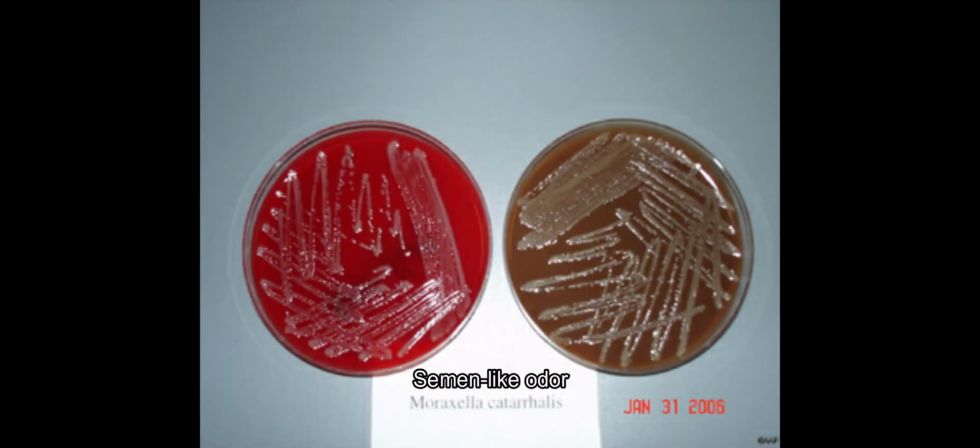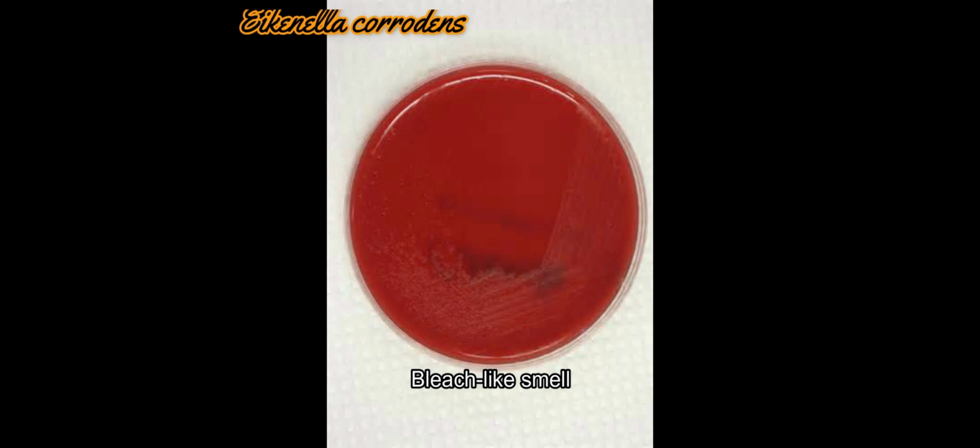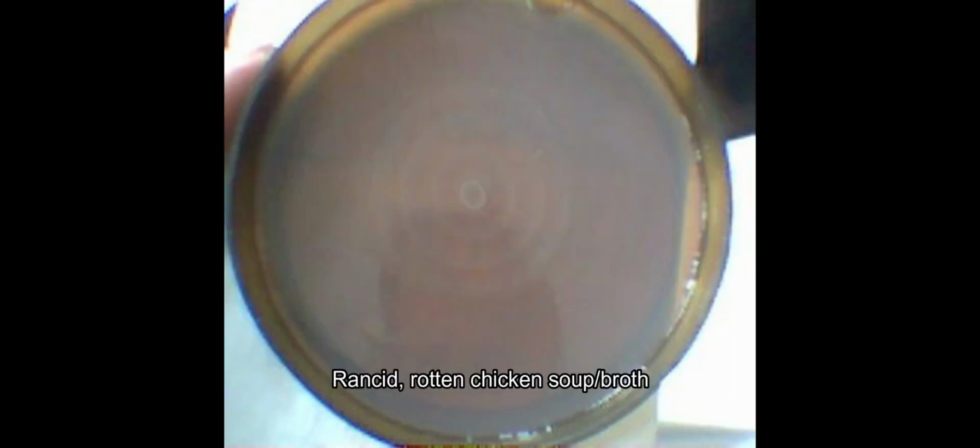The third one is Moraxella catarrhalis, which produces a peculiar semen-like odor. The fourth one is Eikenella corrodens, which gives off a bleach-like smell, familiar from cleaning. And the last one is Proteus mirabilis, which produces a rancid, rotten chicken soup or broth scent.